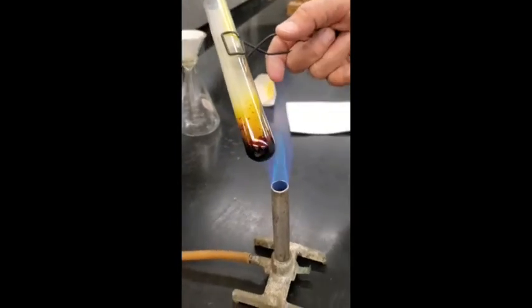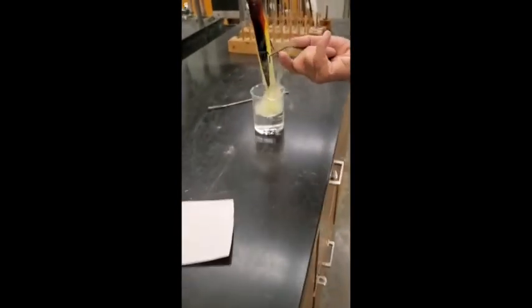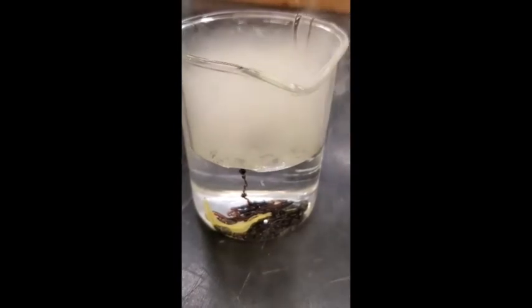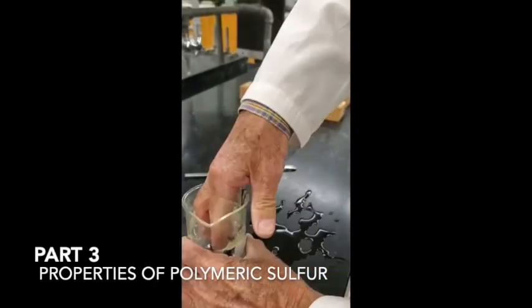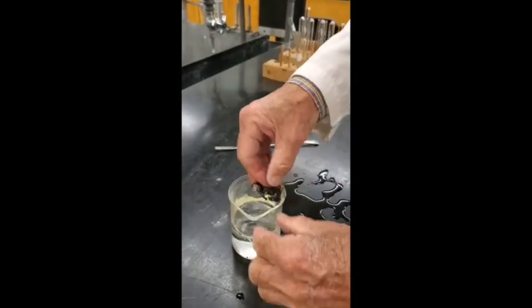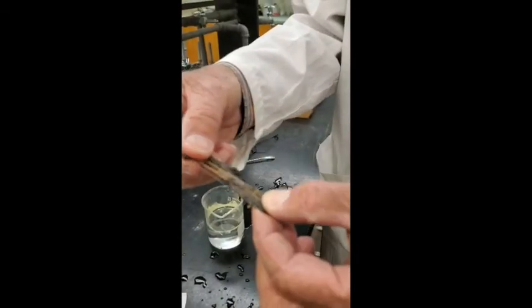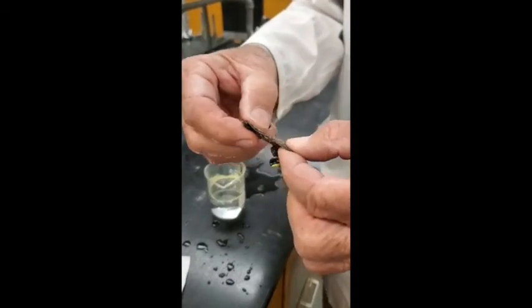Once it flows, I'll pour it into this beaker of water. There are some vapors coming out too — you see the vapors? Let me put this in the hood and get a little bit of sulfur. I'll get some up with my fingers and bring it out here — watch this. It stretches! It's kind of hot, sorry. It stretches, it's rubbery. It's like rubber, and rubber is a polymer too. So it's a polymer of sulfur. We call this plastic sulfur. That's another allotropic form of sulfur — it's not crystalline.